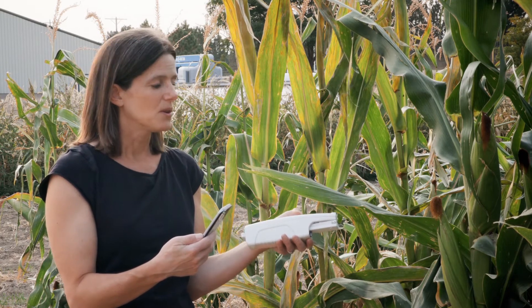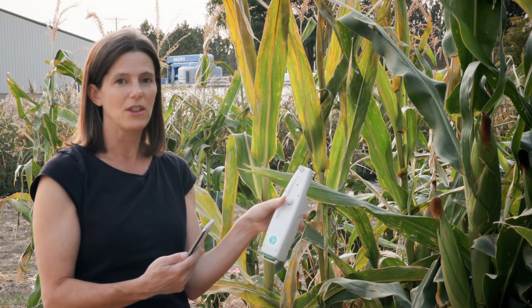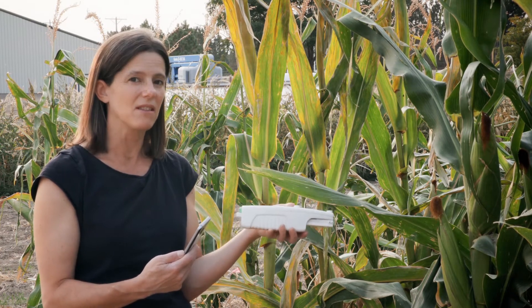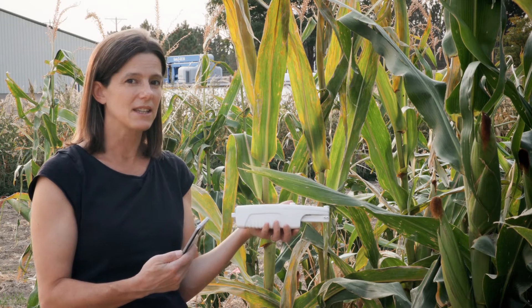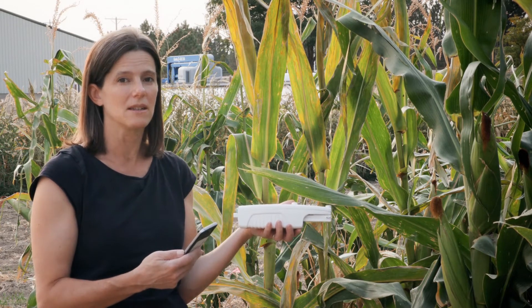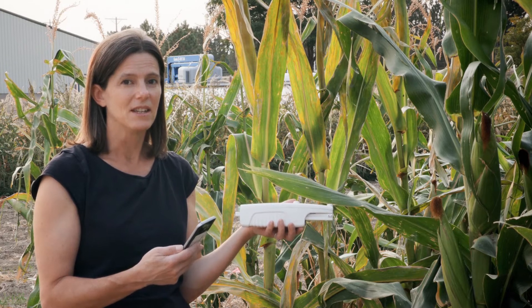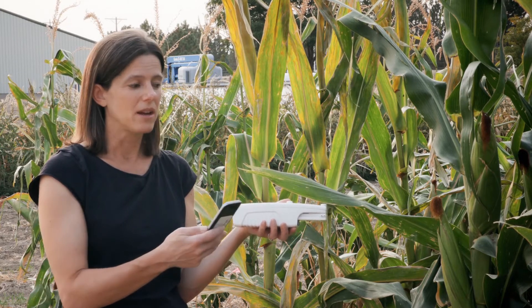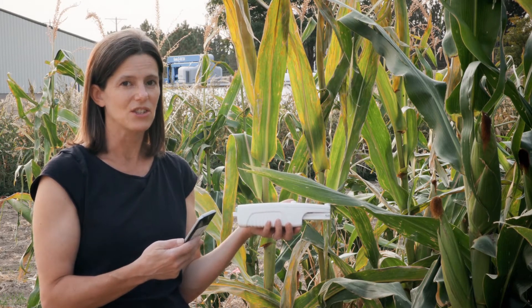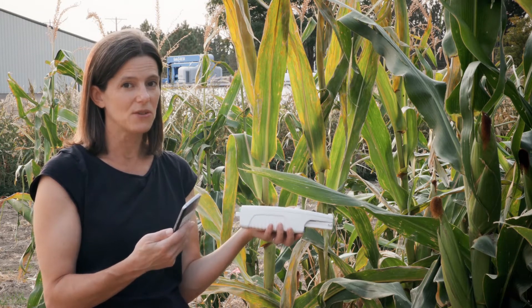The other piece it has is this circle on the front here. This is an ambient light sensor, so it's measuring how much incoming irradiance or light intensity there is, and it uses that as an input in the calculations for photosynthesis as well.